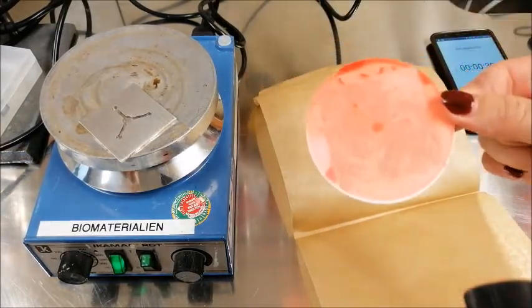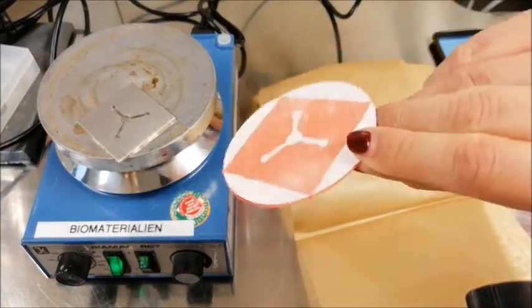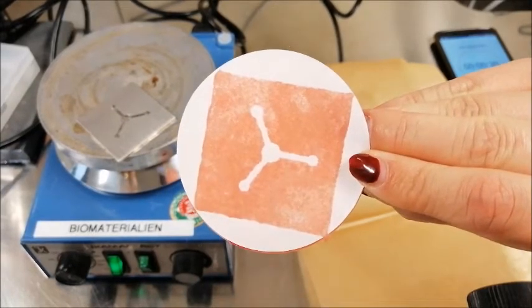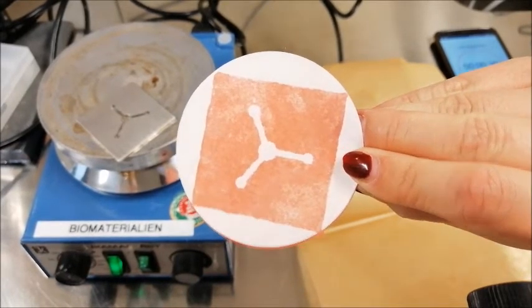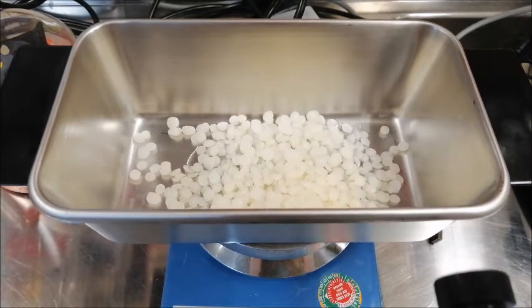After turning the device to the other side, the detection zones can be loaded with detection reagents.